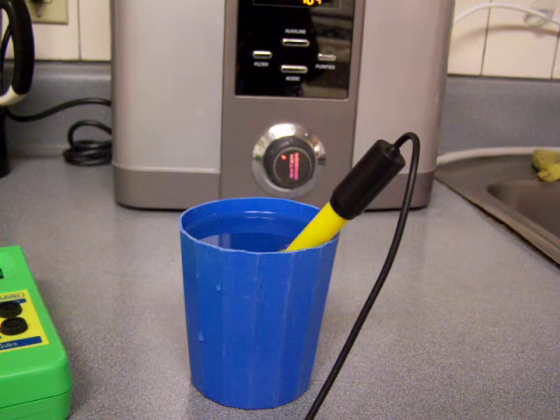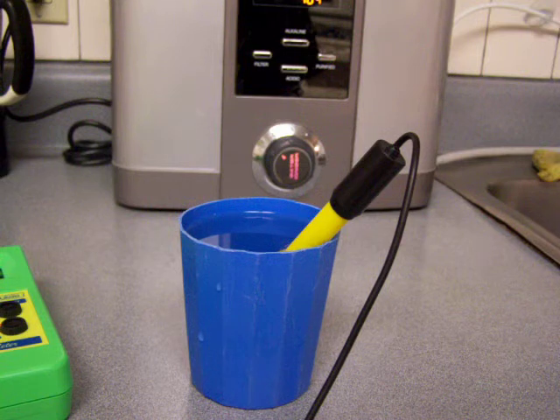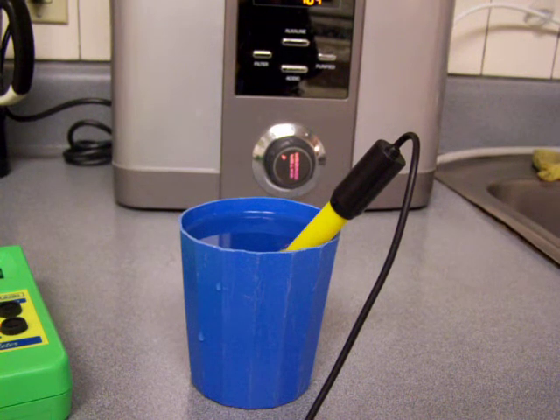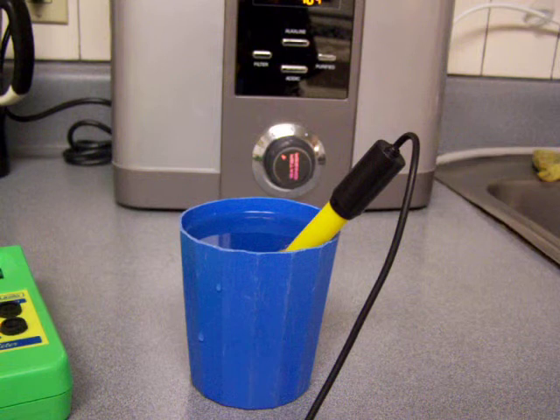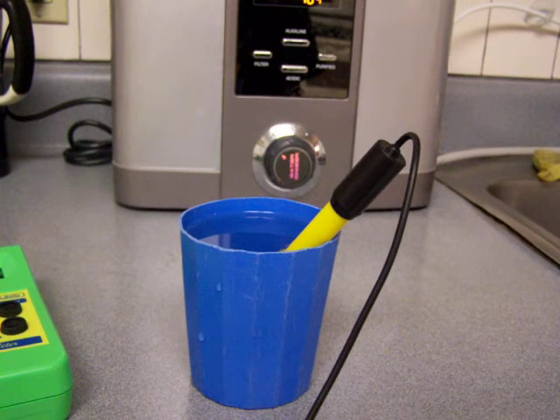So what I'm going to do is I'm going to boil this water and then I will let it cool and then I will redo the pH of it and see what happens.